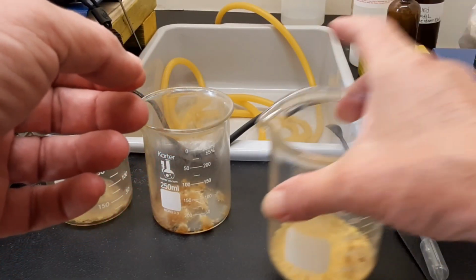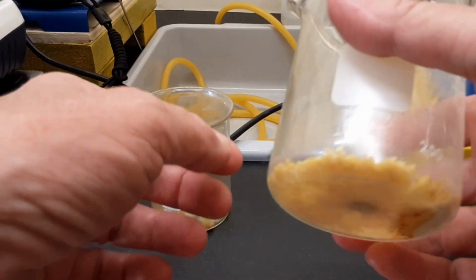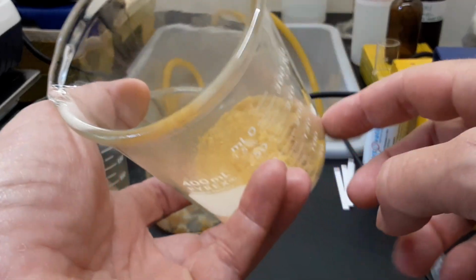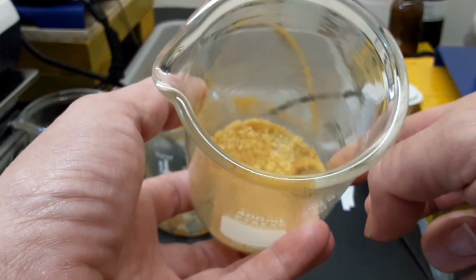So anyway, that's why I used the isopropyl again on this one. Color, strangely, is much, much nicer, with the exception of this big clump over here that I'll get to in a minute.